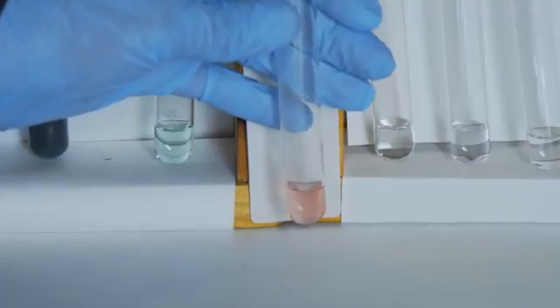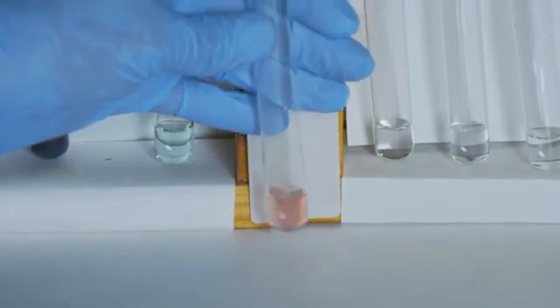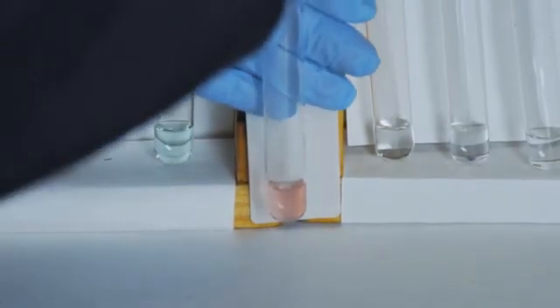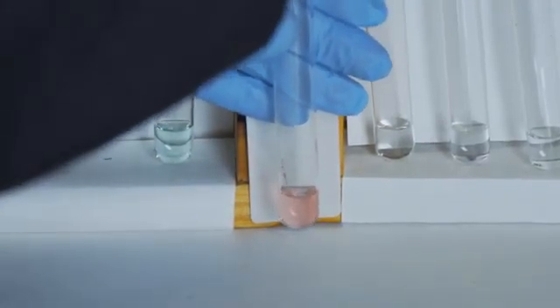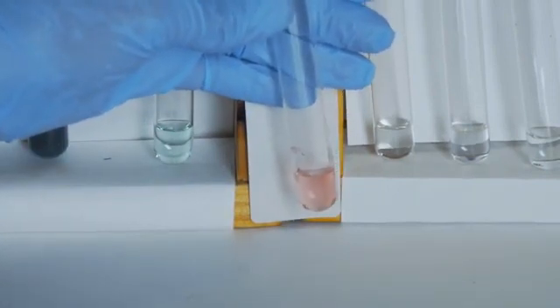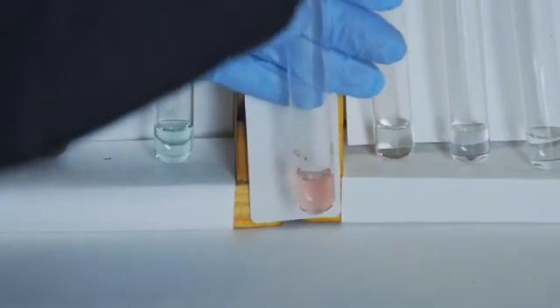To our unknown solution E, which is pink in color, we add in 3 drops of the ammonium chloride and 5 drops of the ammonium hydroxide.